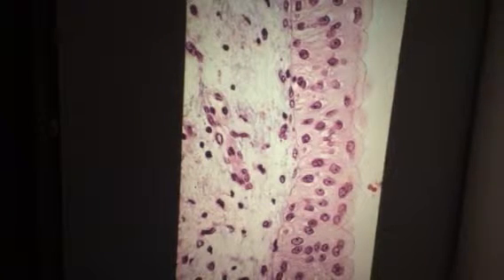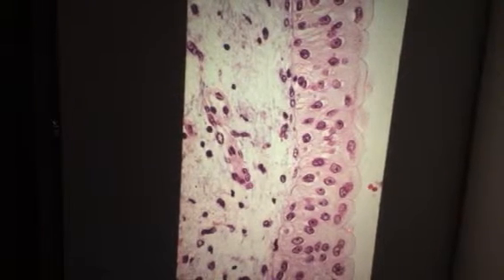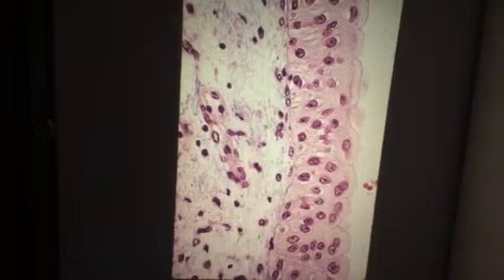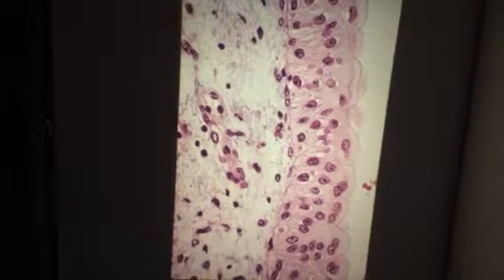Okay, and how about this tissue right here? Transitional epithelium. And what is that particular cell we see right there? Dome cell or umbrella cell. What surface do we have here? Apical. And that would make this surface the basal surface. And how about this tissue? Skeletal muscle. And the dark lines we see would be what? A-bands, and the lighter lines would be I-bands.